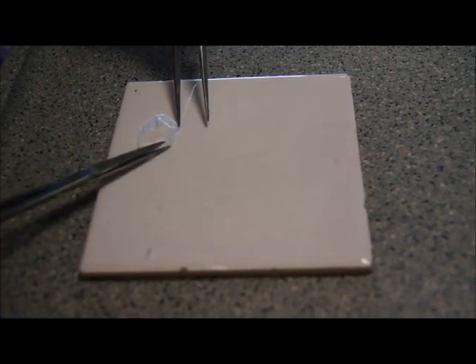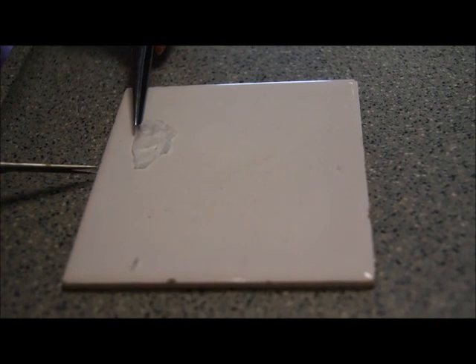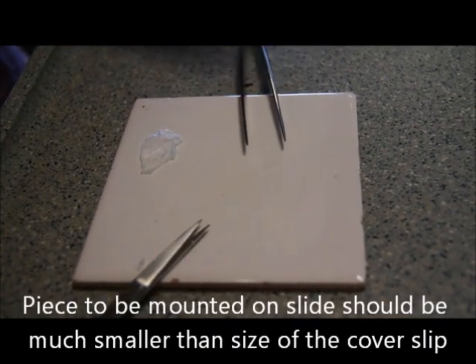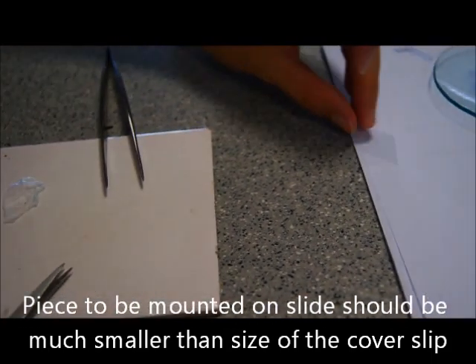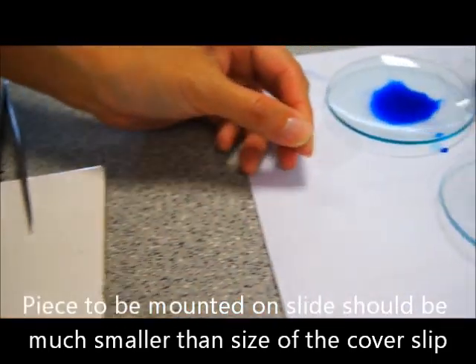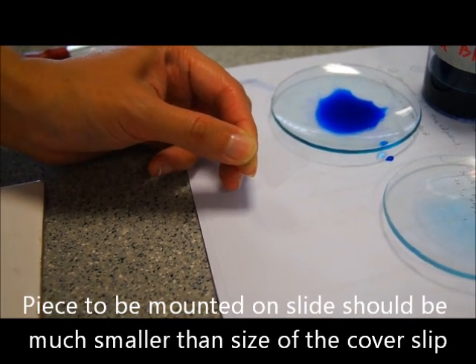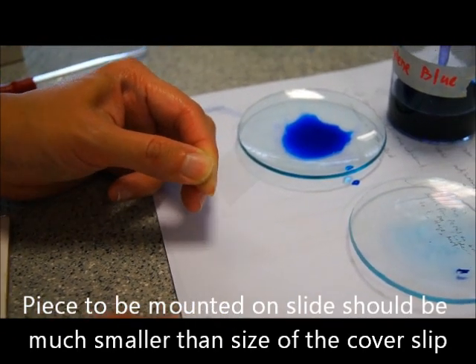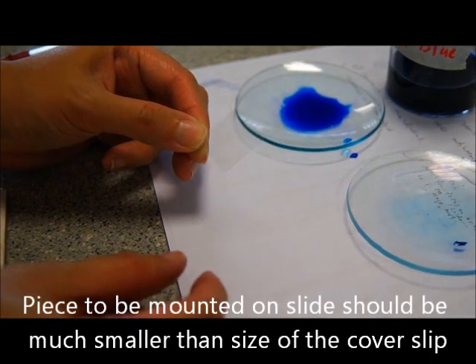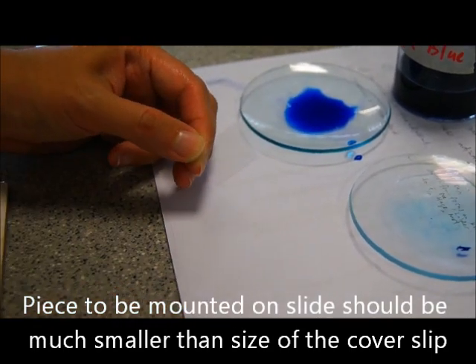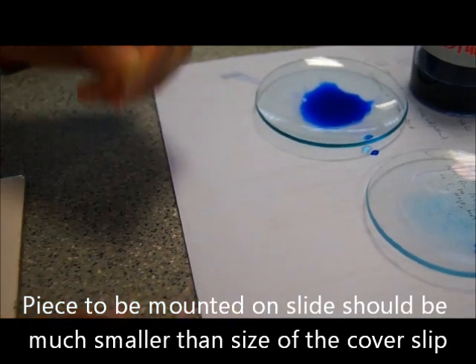Now that you have gotten the epidermis out, you will get a very large piece but actually you don't need it so big. So you'll need to cut it but you may ask what size we cut it into. Basically, what you should use as a gauge is your cover slip. So this cover slip actually goes on top of the sample. So the piece of sample that you want to cut should not be bigger than the cover slip because we want the cover slip to cover it fully.